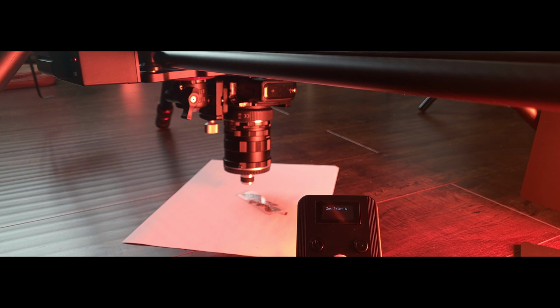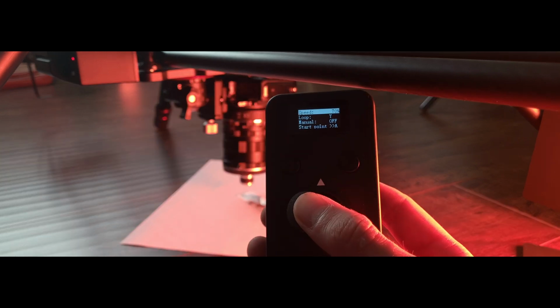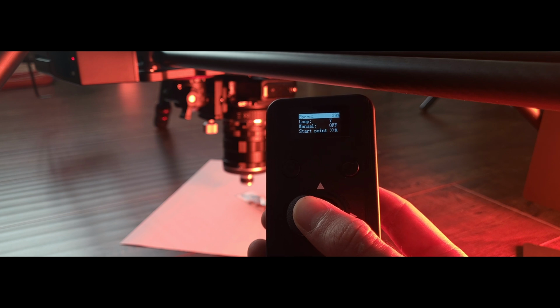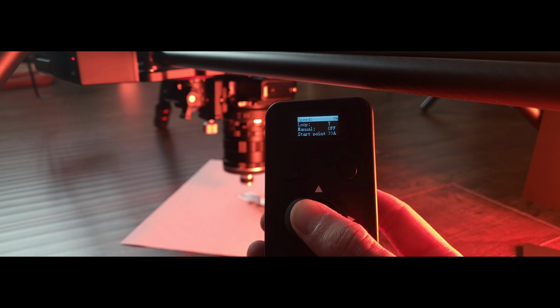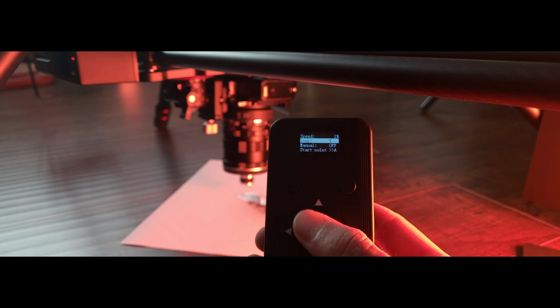I will try to use my slider for more stable motion, especially when recording video. Considering that I'm using 10x lens, I will set my slider for the slowest speed, which is 1%.